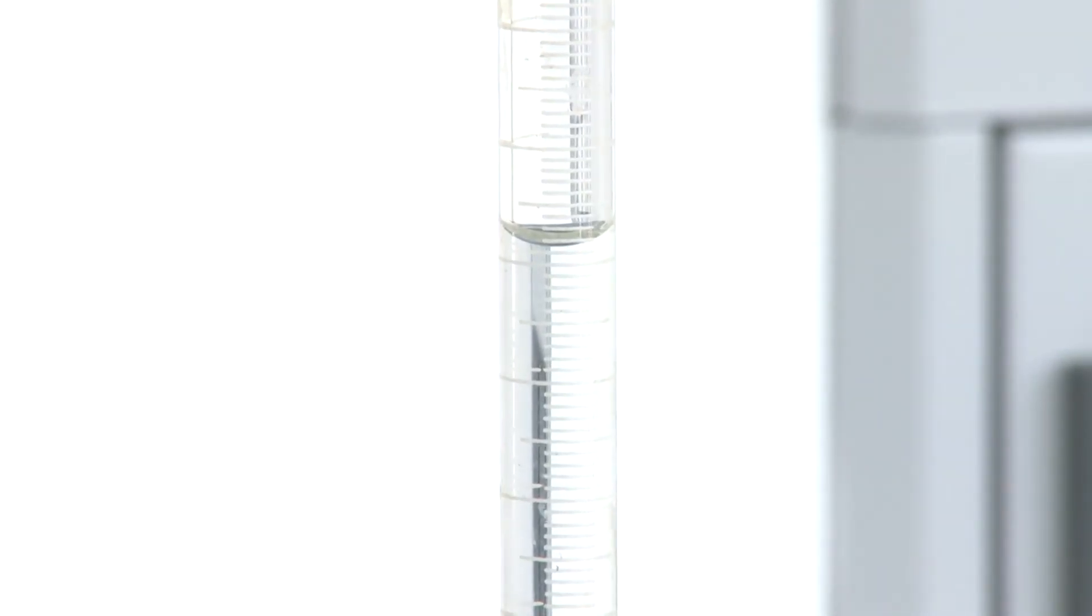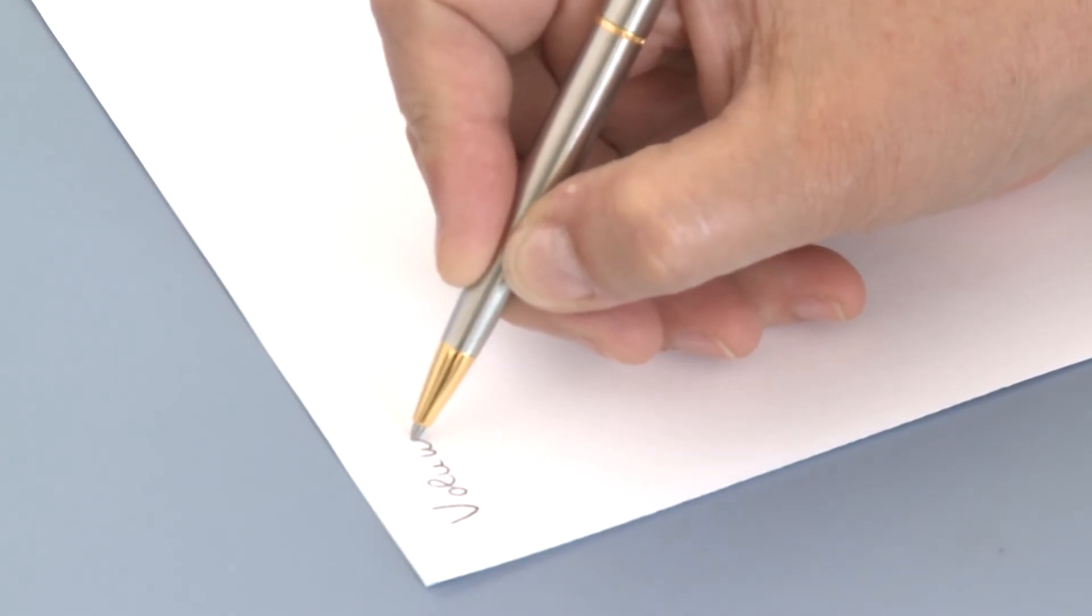Finally, record the volume of silver nitrate used in the assessment.